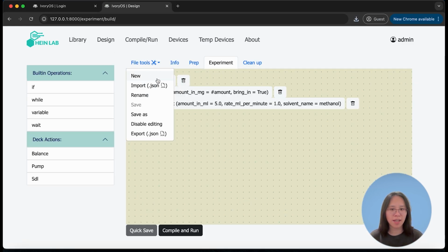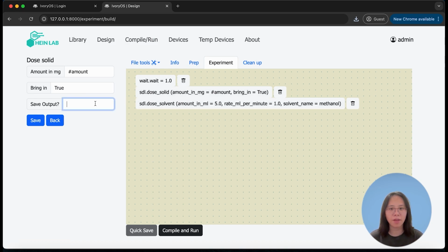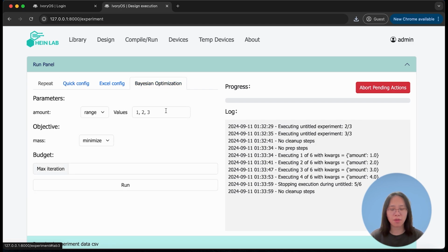So now back to the design. If I would like to configure an output value, for example, how much amount I dosed using the automated balance, I want to save this as mass for my output. So now I save this back to the workflow and I compile it. Now you will see the Bayesian optimization option is available. In this control panel, it will generate all the inputs for all parameters and objectives.